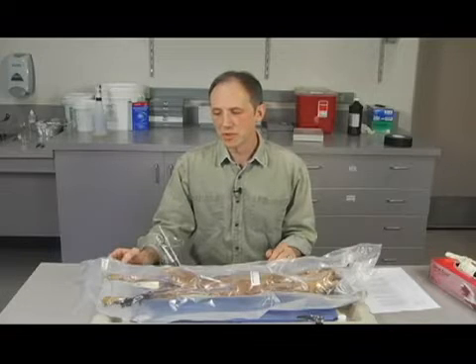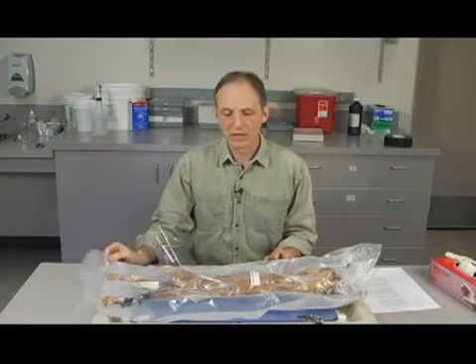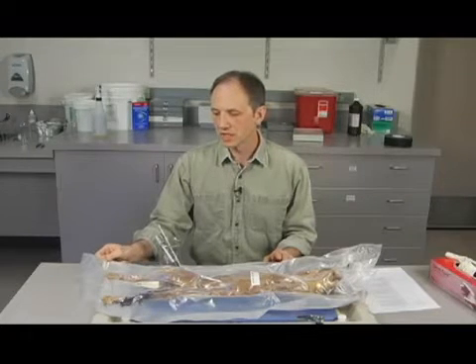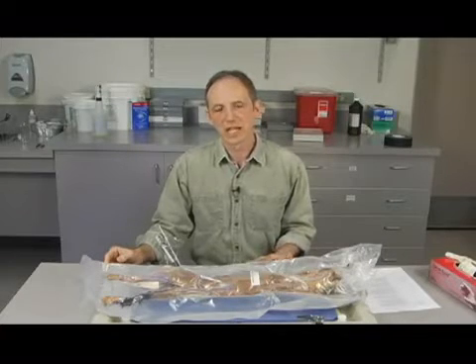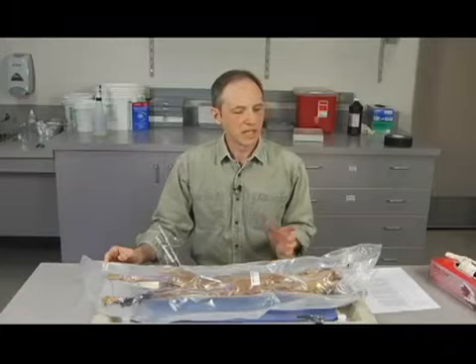so that they don't get dried out and things like that. So what I'm going to do here in a moment is cut the outer bag and show you the cat, take the cat out, and we can then look at the specimen in some detail. First I'm going to cut this bag, but I'm also going to put on some gloves. Gloves are a basic part of the class when we use specimens. We have different kinds of gloves for people that have different needs and different sizes, but you'll have gloves available for you. I'm going to put some on and then take the cat out of the bag, okay?